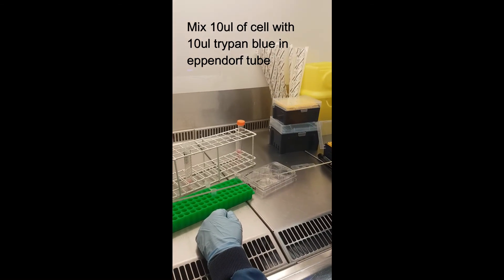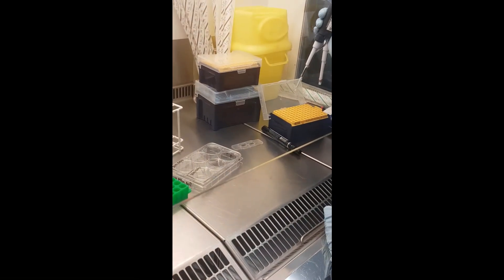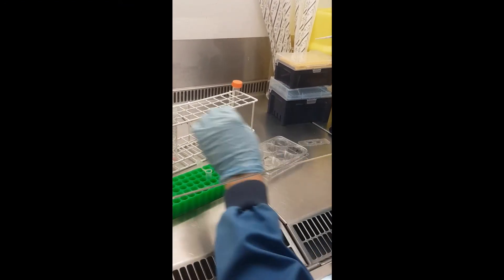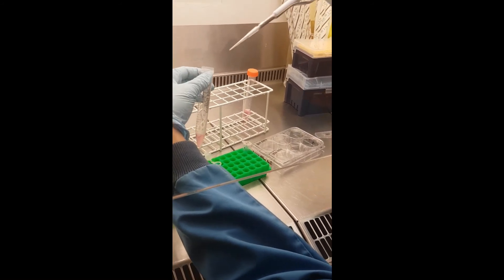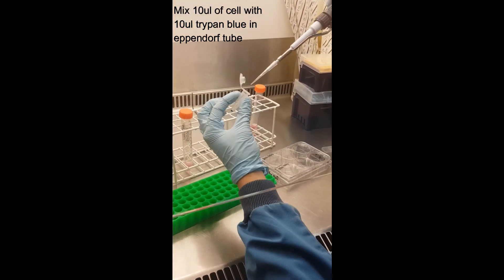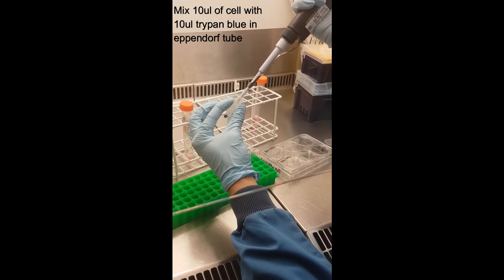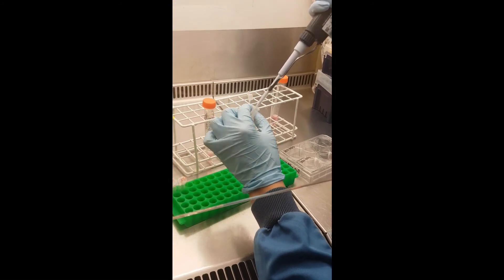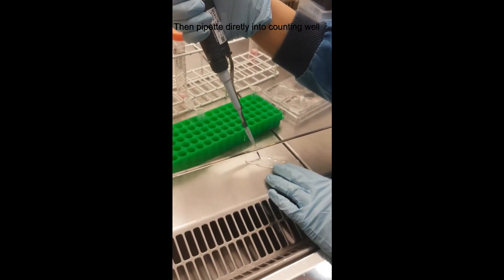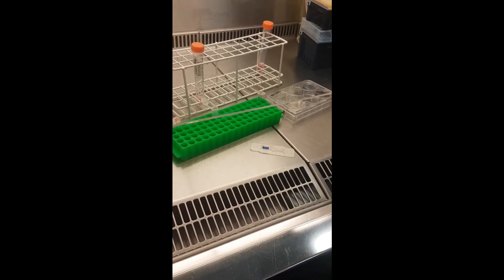Check again that you have the right pipette. Don't press too hard in the pipette box — that risks breaking the pipette. Put the pipette tip on firmly and it should be snug. Resuspend just before taking out 10 µL. Mix 10 µL cell suspension with 10 µL trypan blue — pipette up and down about 10 times and swirl to mix well. Then load the counting slide: quickly pipette into the half-moon shape and the cell suspension will spread across the counting area. The sample is now ready for counting.